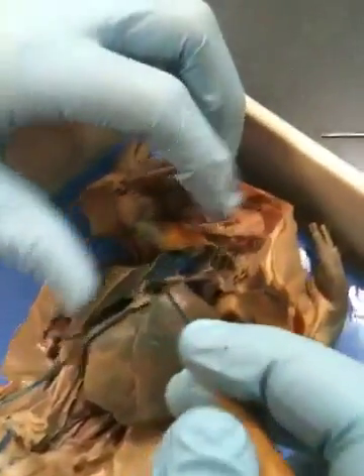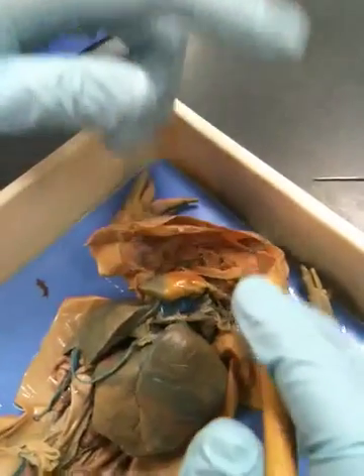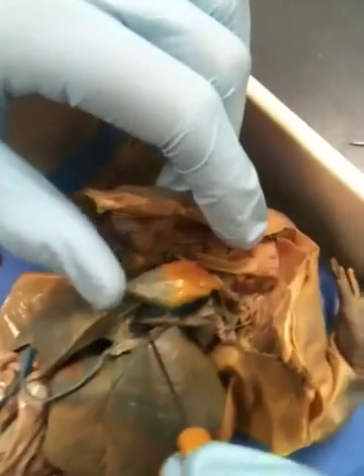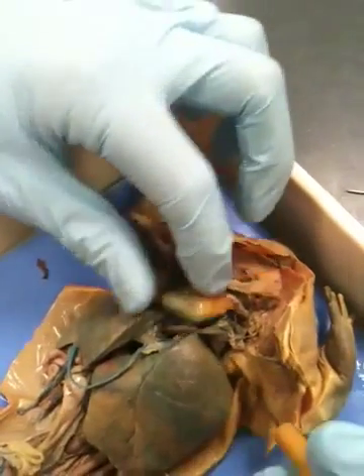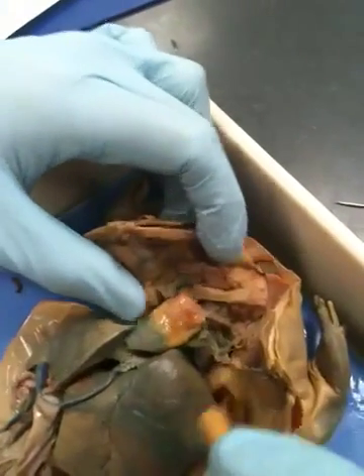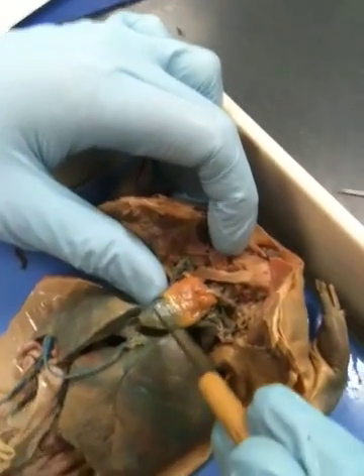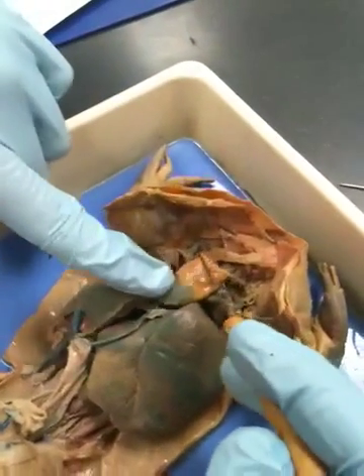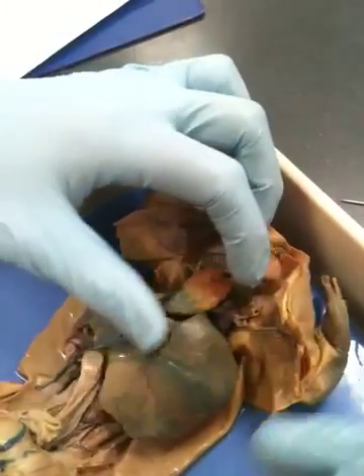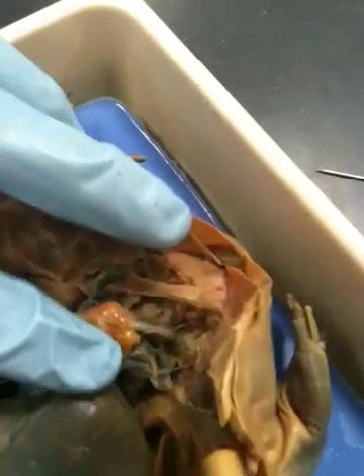Let's see what other veins we have. A frog does not have a superior and inferior vena cava. It has an anterior and posterior vena cava. This is the posterior vena cava. The anterior vena cava attaches somewhere underneath here. This is called the sinus venosus, also the heart for most normal people. Ventricle and the right atrium, the left atrium. Also, there are aortic arches that come out of this right here and here.